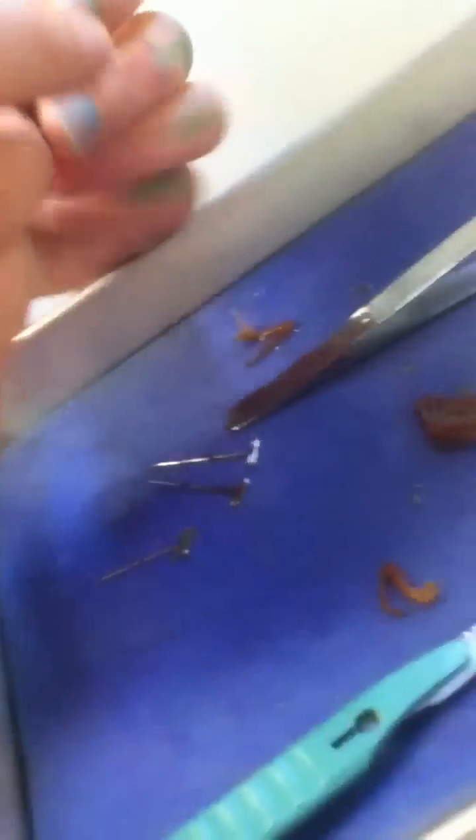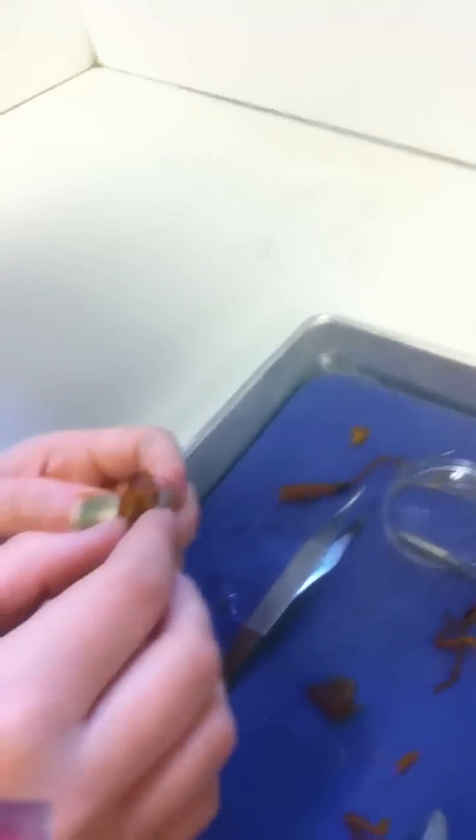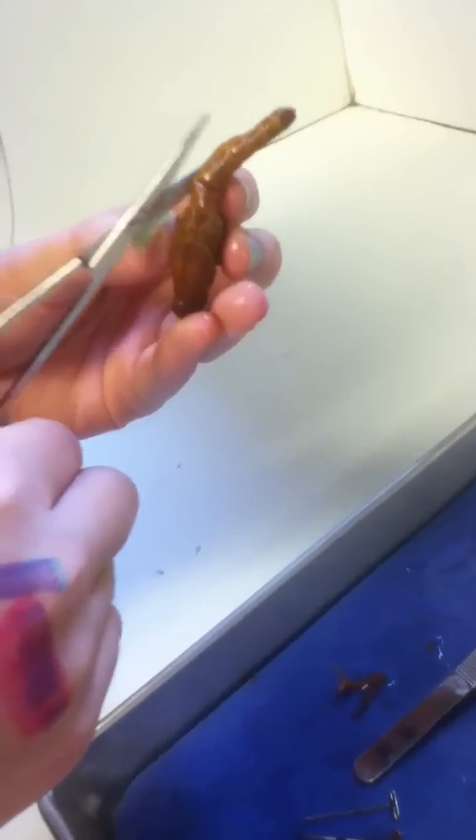I think we're all done cutting. Now we just have to open it up somehow. Okay, you hold this. Did I get any juice stuff on it? I don't care, it's in water. Ew, no! You're like touching the inside. I know. How are we supposed to cut this guy open? I don't know, this is super hard. It's a tubule. Safety first. Safety first.